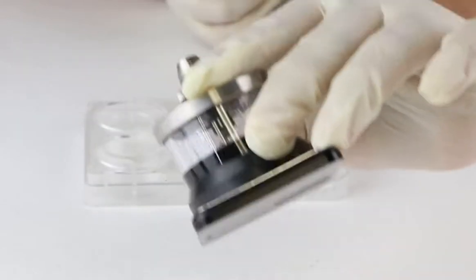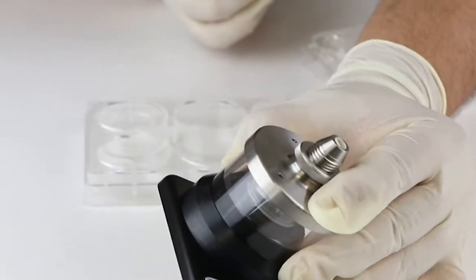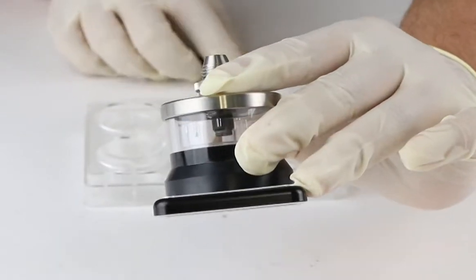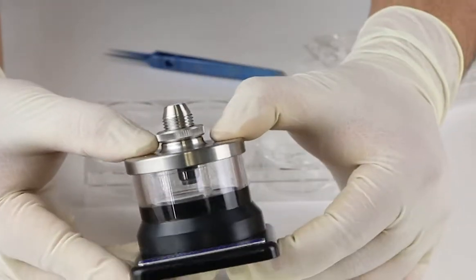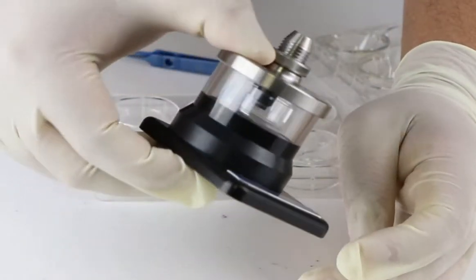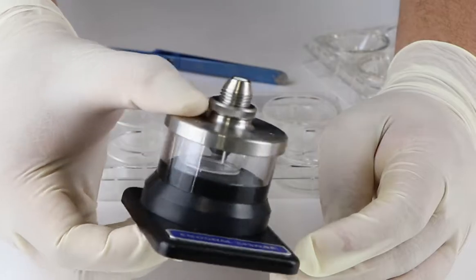The placement of the standing insert in the chamber may affect the readouts. When the endohm chamber cap or top electrode is put on, it helps in bringing the insert towards the center.